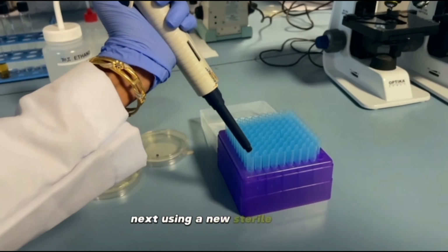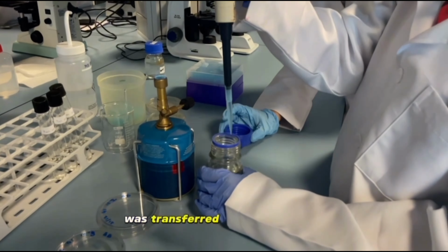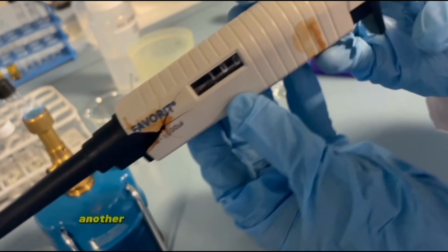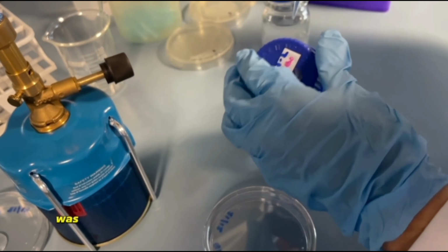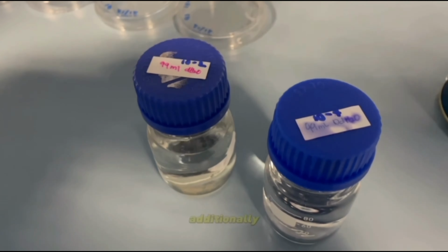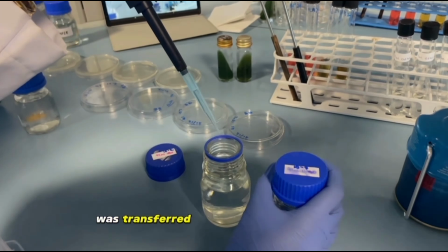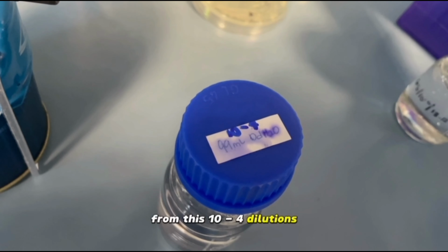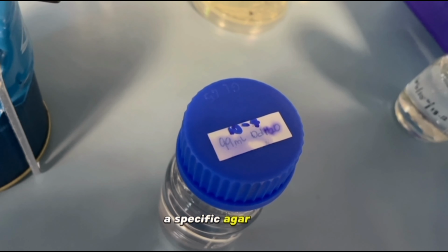Next, using a new sterile pipette, 1 ml from the 10^-2 dilution was transferred to the agar plate labeled 10^-2. Then, another volume of 0.1 ml from the same dilution was transferred to a different agar plate labeled 10^-3. Additionally, 1 ml from the 10^-2 dilution was transferred to the 10^-4 dilution flask.